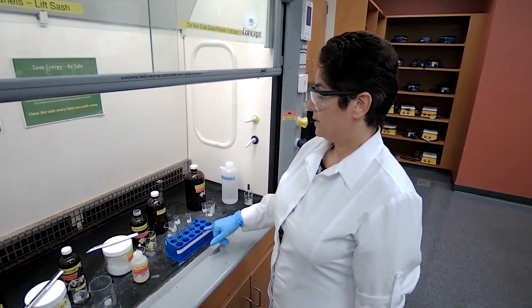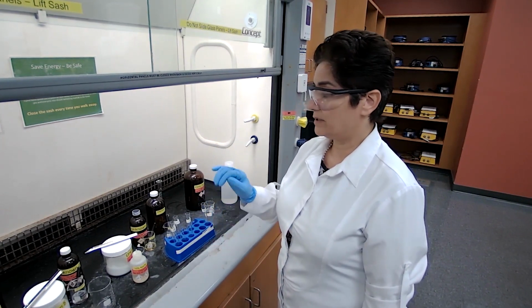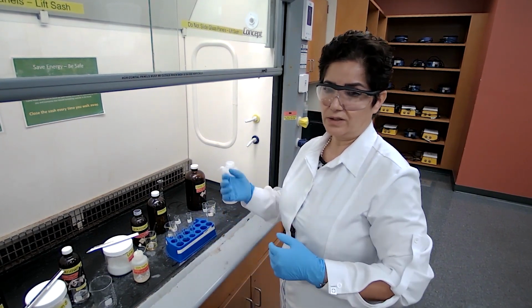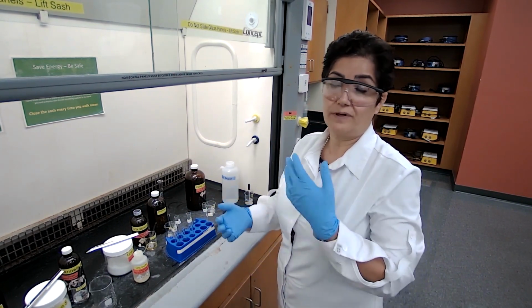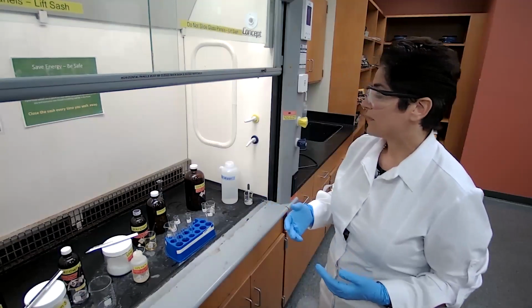Dissolved in HCl. Unknown 3 dissolved in sodium hydroxide, and it also dissolves in sodium bicarbonate. So you can record this observation and use the tables provided in the experiment to identify the functional group, and if needed, following the procedure, we do the classification test.